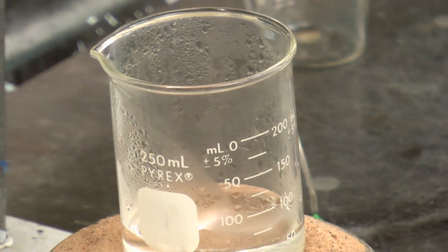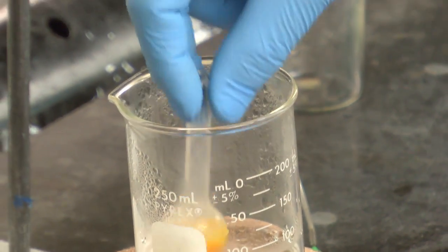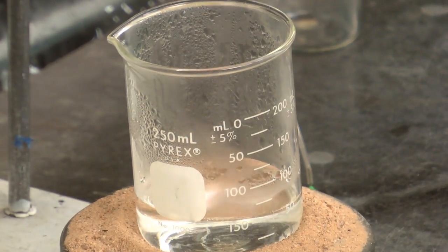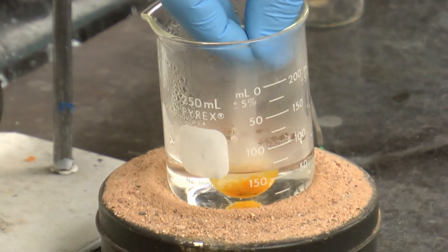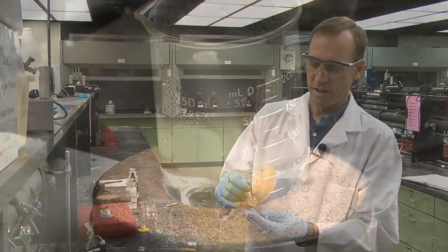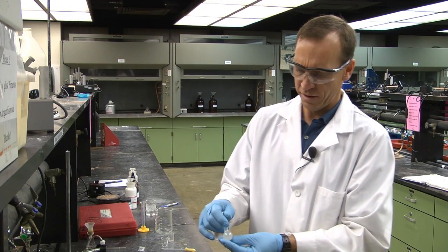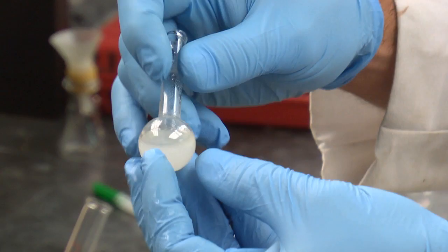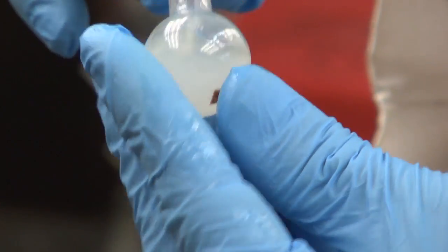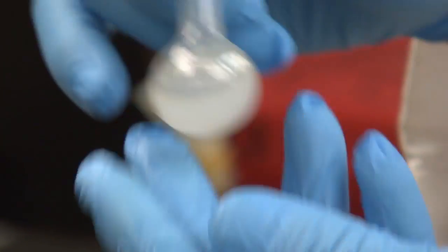And I'm just going to let it sit in the reaction bath for 5 more minutes to help break up those aluminum chloride salts. Okay, so I've heated the workup for about 5 minutes in the hot water bath. It looks like most of the aluminum chloride salts have broken up.